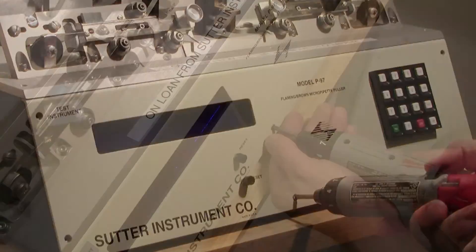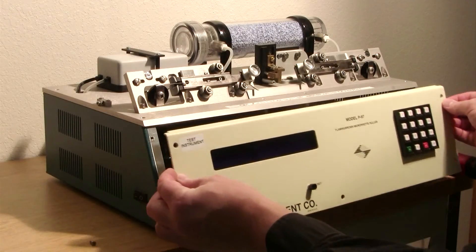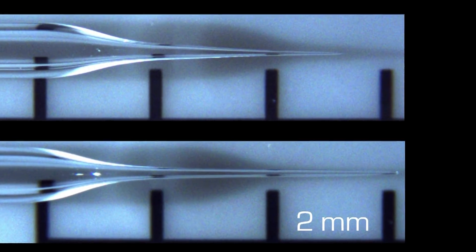On the filament pullers drop the front panel and perform the same test with the lower pulleys. If any of the pulleys on your instrument is sticky that may account for inconsistent pull results.